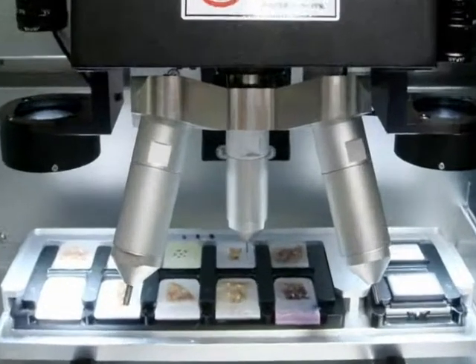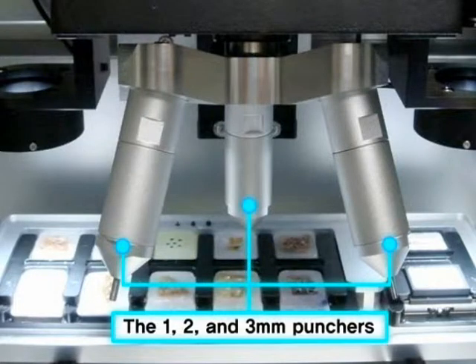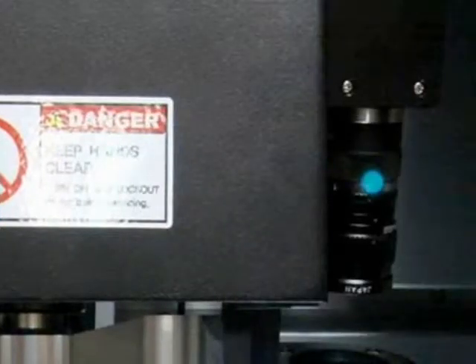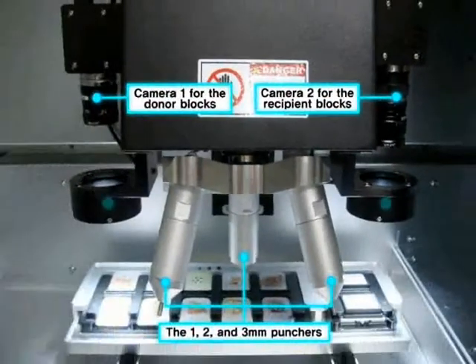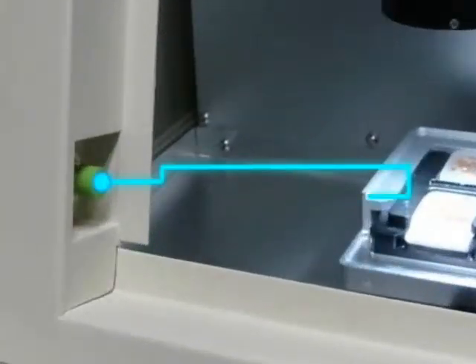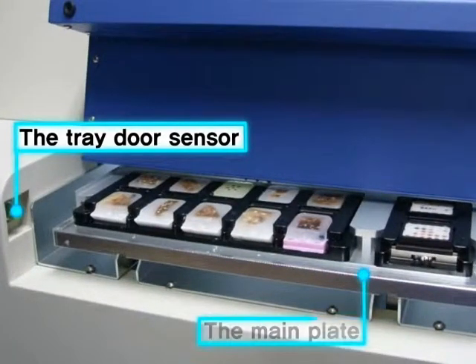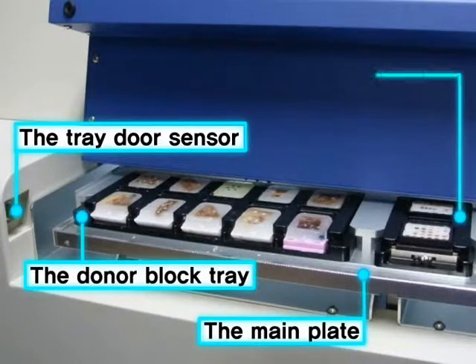Inside the instrument are the puncher module, the one, two, and three millimeter punchers, camera one for the donor blocks, camera two for the recipient blocks, LED lighting, the front door sensor, the tray door sensor, the main plate, the donor block tray, and the recipient block tray.